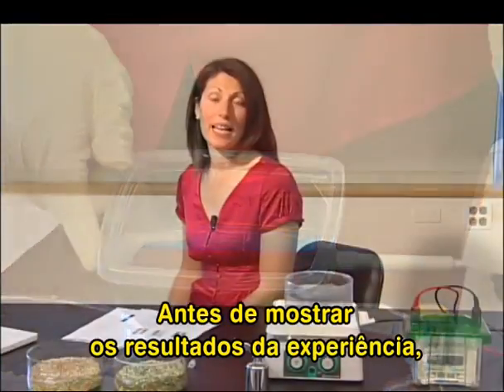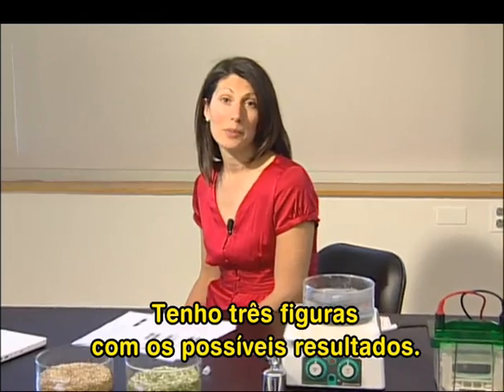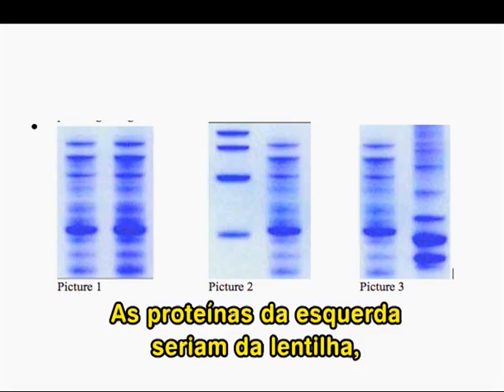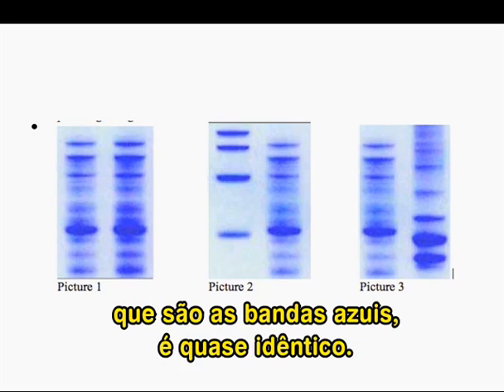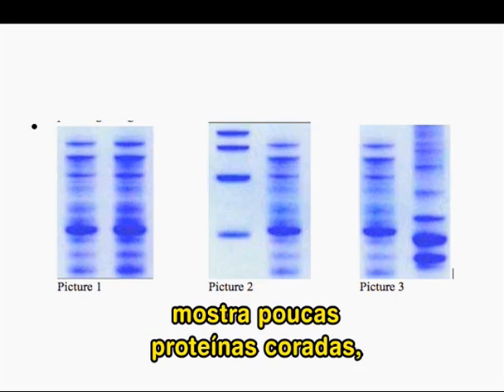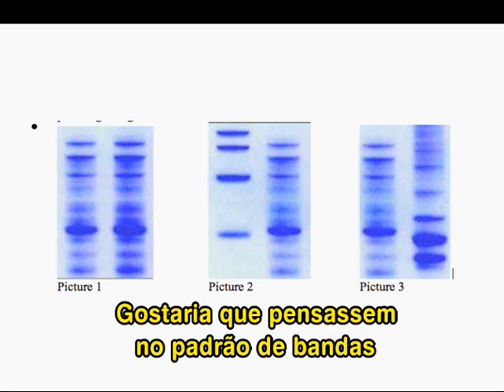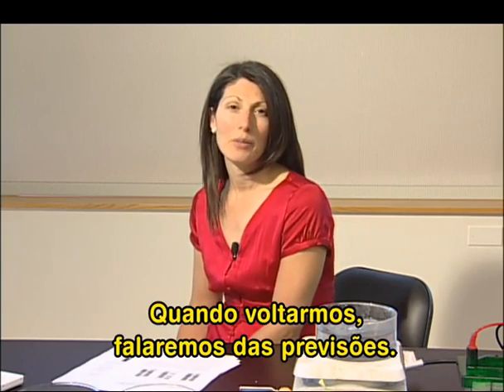Before I show you what the results of this kind of experiment might be, I'd like you to take some time to make some predictions. I have three cartoons for possible outcomes. In the first cartoon, the two blue staining patterns look almost identical — the one on the left is proteins from lentils, the one on the right from green peas. In the second picture, lentils have only a few stained proteins whereas green peas have many. In the third picture, there are many proteins for both, but they're quite different from one another. Take some time to think about which banding pattern you might expect, then come back and we'll talk about your predictions.